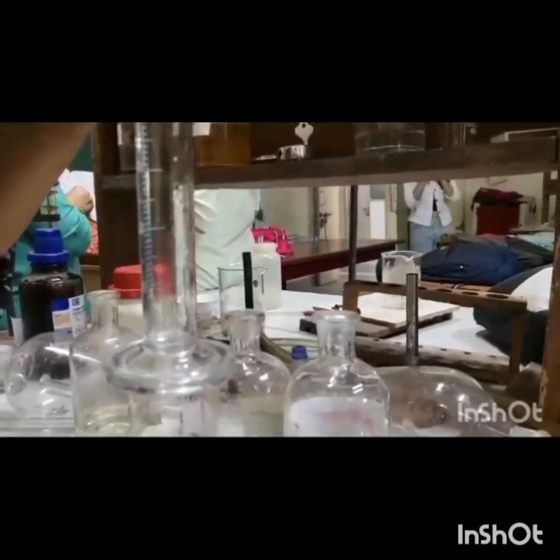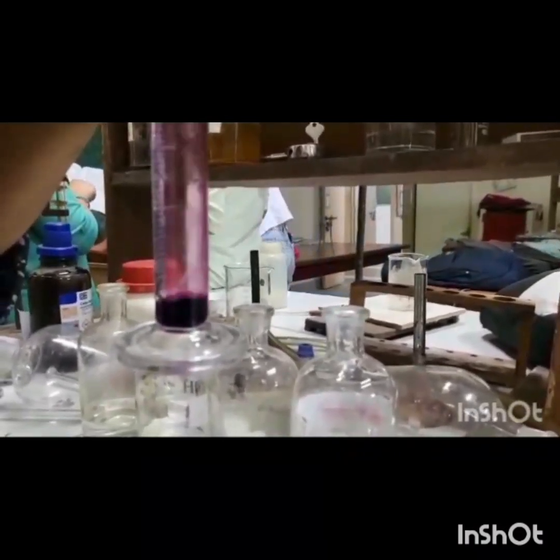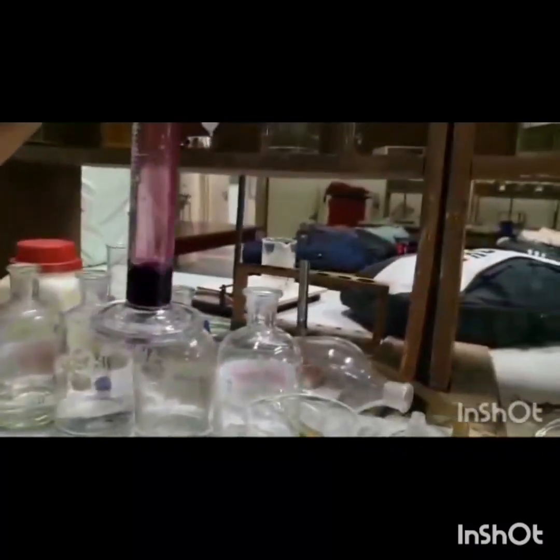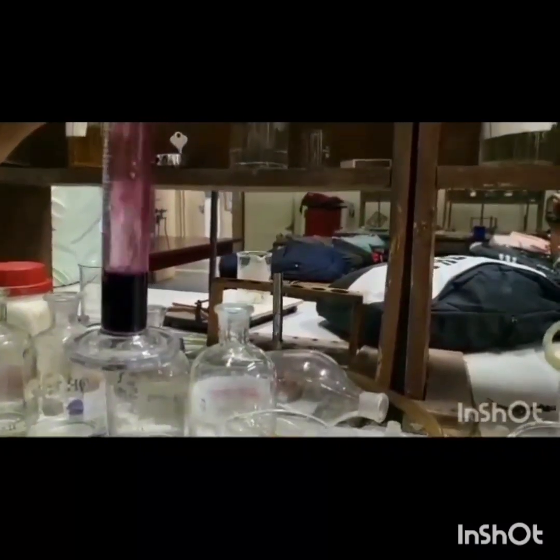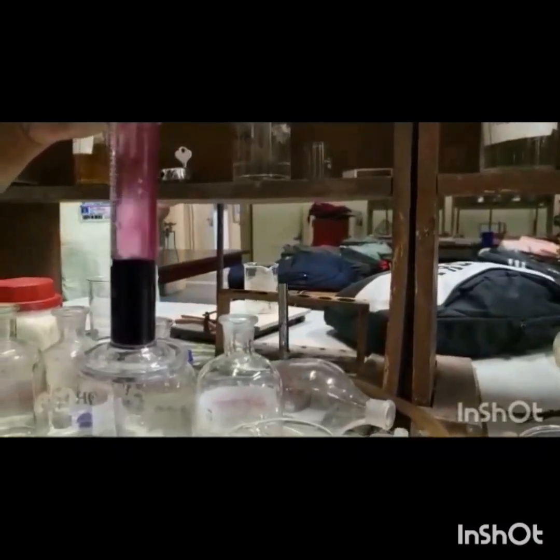Now we will measure 25 ml of iodine solution and will pour it in the container, that is bottle number 1, then 20 ml in bottle 2, 15 ml in bottle 3 and 10 ml in bottle 4.